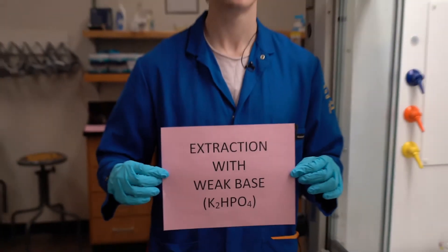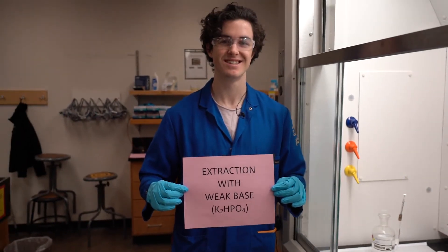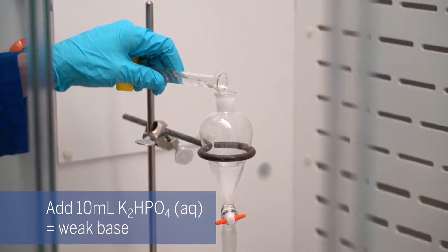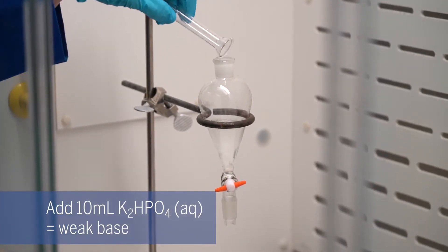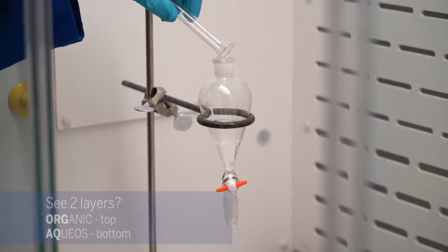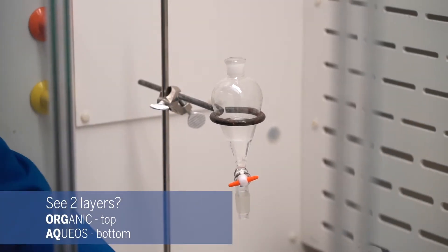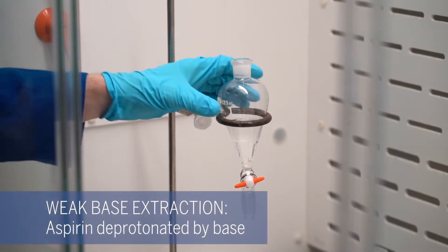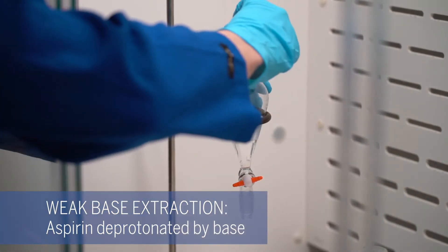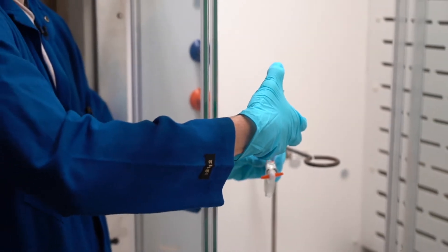This is 10 mils of potassium phosphate. We'll be using this to deprotonate the carboxylic acid, and when we add this potassium phosphate we'll be creating two layers inside — one aqueous and one organic. We'll be driving aspirin into the aqueous layer by deprotonating the carboxylic acid. Make sure that all of the aspirin is deprotonated.